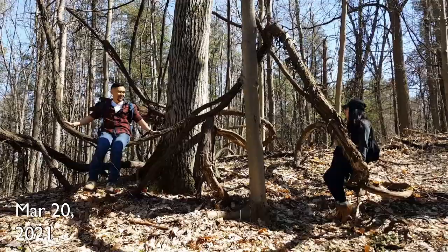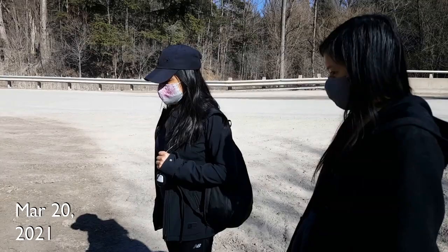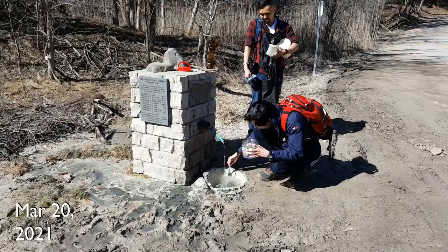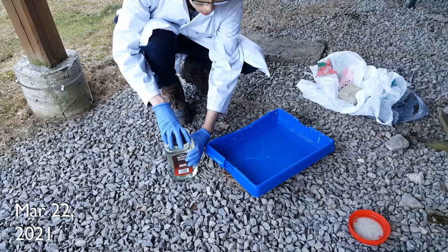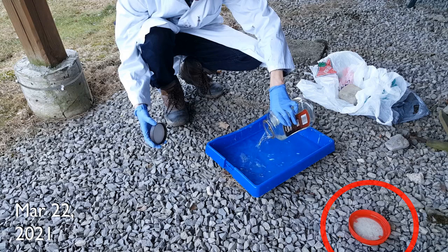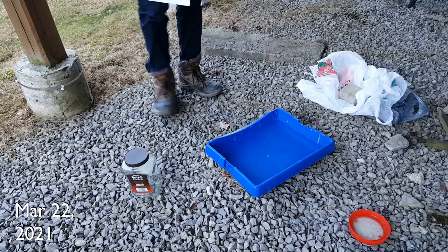So I went back a few days later with some more of my family, this time not to collect from the sediment, but from the spring water and the white deposits on the side of the draining bowl, which I thought would be a lot less contaminated. I collected about six liters of the spring water and as much of the mineral deposits on the side of the bowl as I could. When I got home, I poured out two liters of the water into a tray to try to evaporate it so I would be left with any dissolved salts, and I also put the bowl scrapings in a little dish to dry. Being in the Great Lakes region of Canada during the arrival of spring, the weather was cold and moist, so it took a while to dry — even four weeks later, the stuff in the tray still hadn't evaporated.